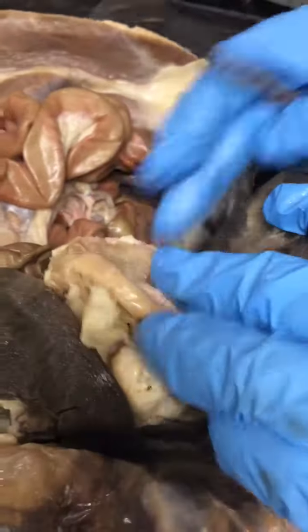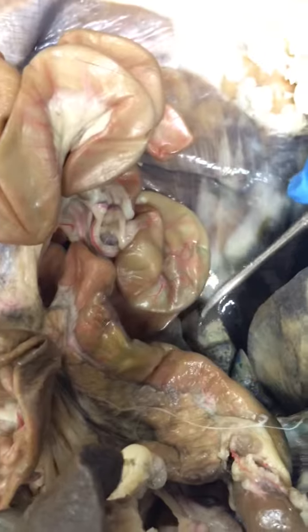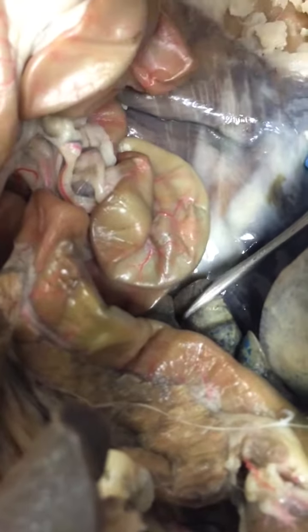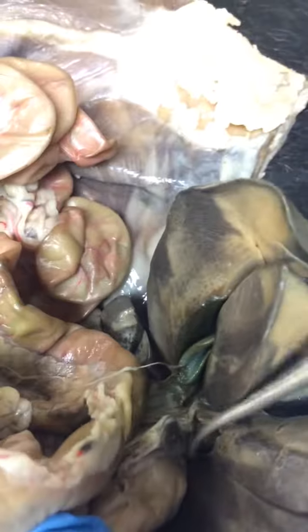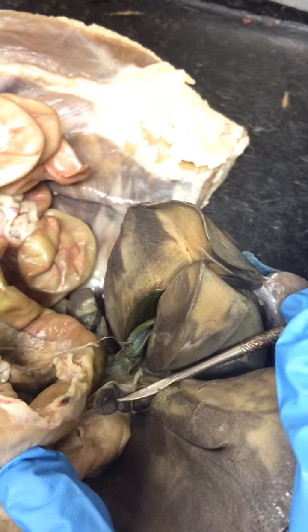If we lift this back up, it's harder to see on our cat. Right down here, right in this area. This is going to be the right lateral lobe of the liver. Okay, so ours is smushed. It would be more prominent on most cats. And then we have the caudate lobe right here. It looks like a tiny little dog ear. Okay.